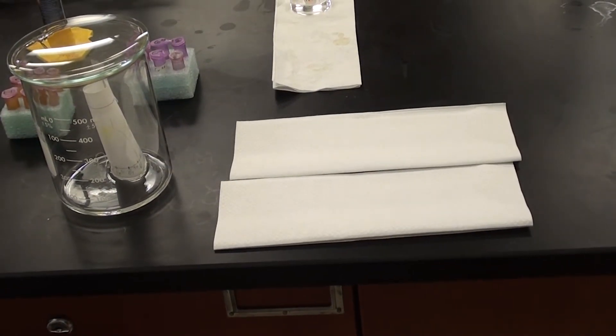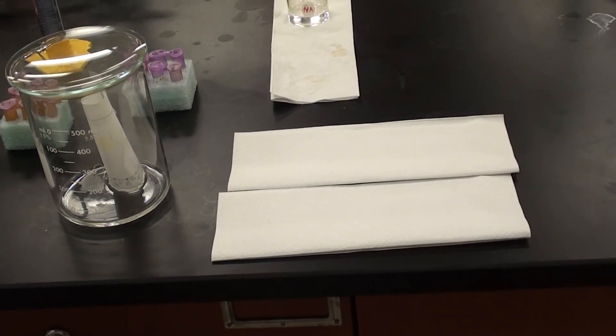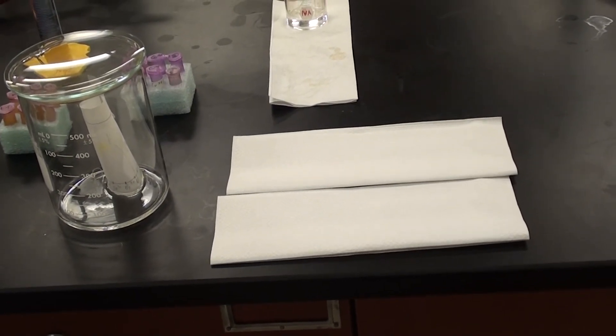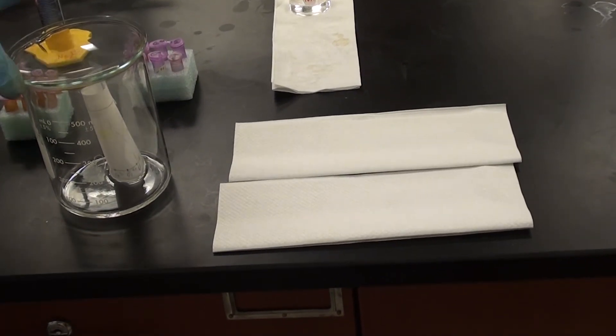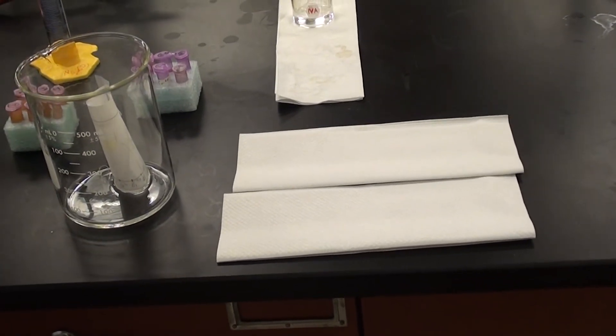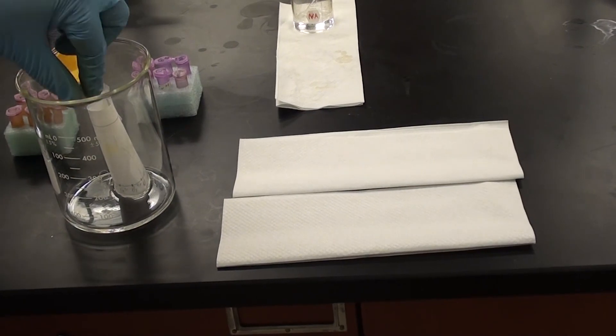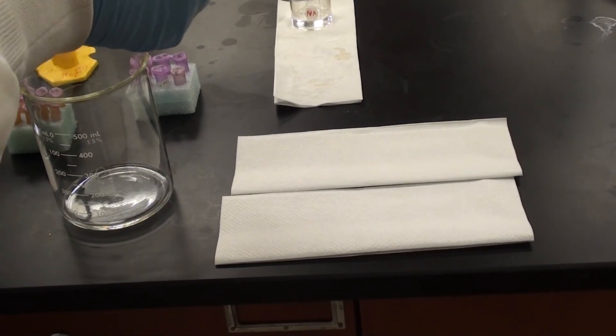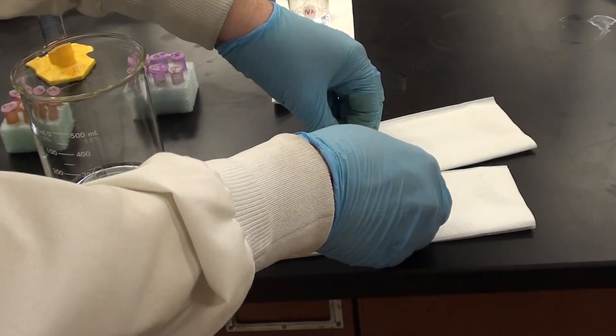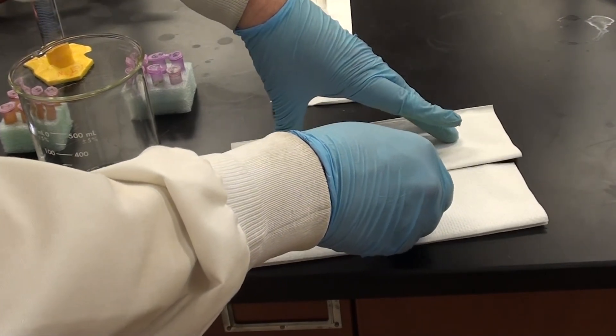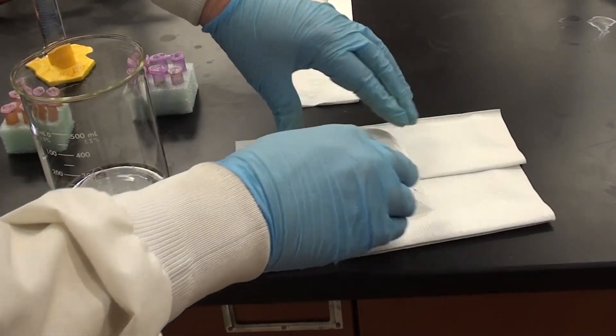So we've been sitting here waiting for the solvent to come up the plate here or the paper. And it's almost to the line so I'm going to go ahead now and pull this out slowly, carefully, untape it.